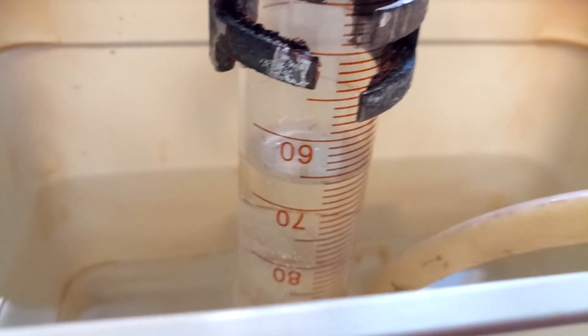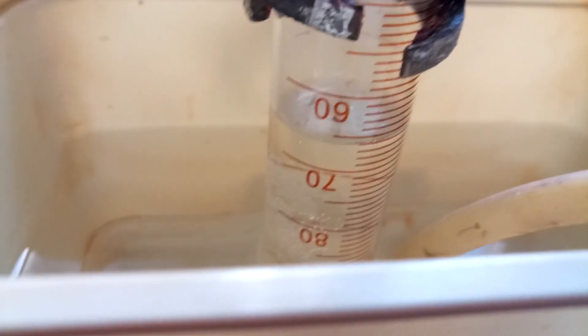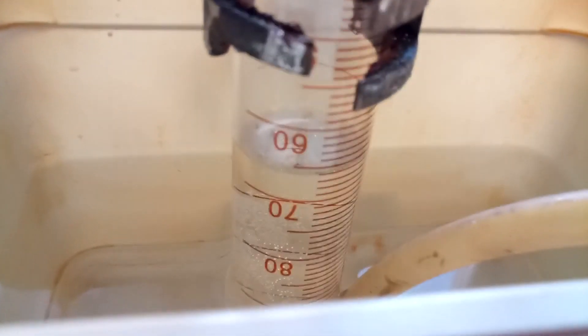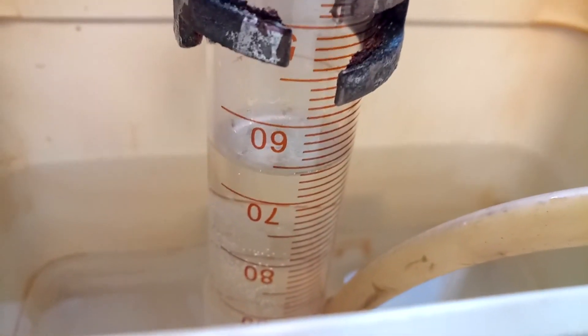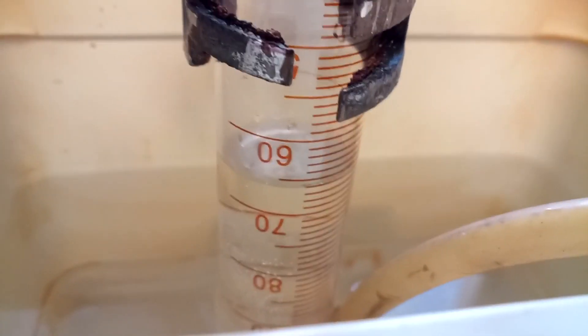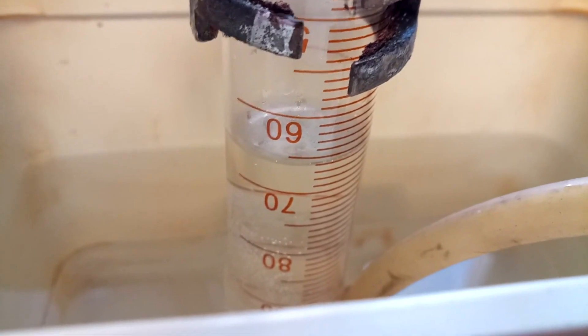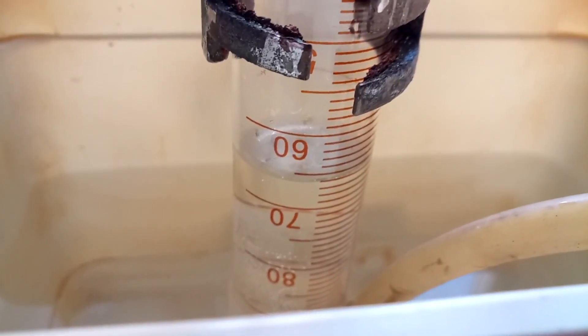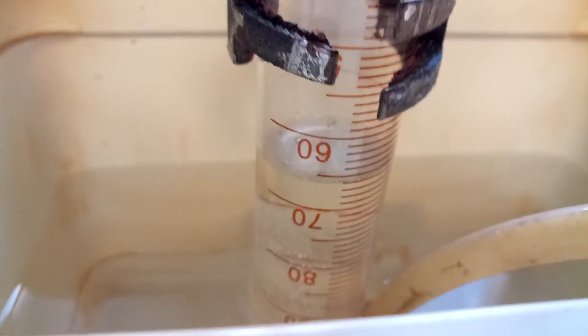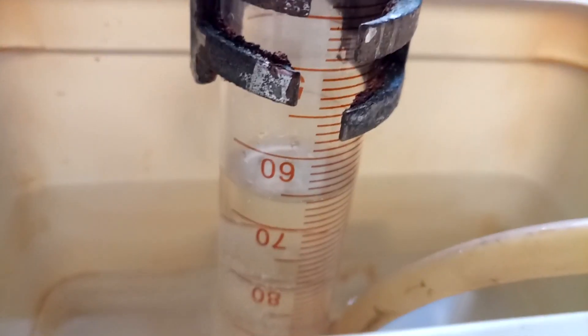After letting it cool so the gas in the apparatus isn't hot and throwing off our measurements, we have 66 mils of gas — so that means 61 mils without the 5 mils of nitric acid — which equates to 47 percent nitrite.